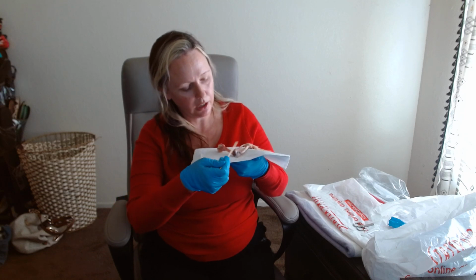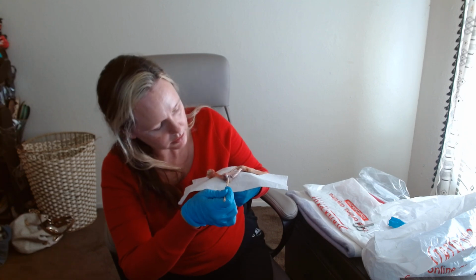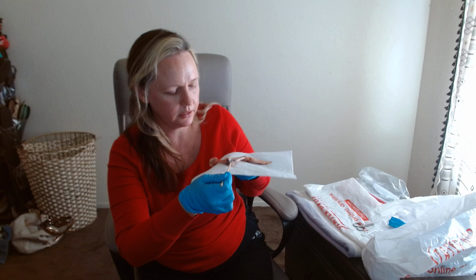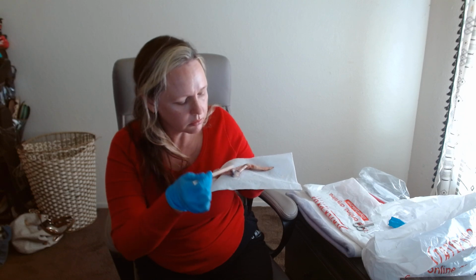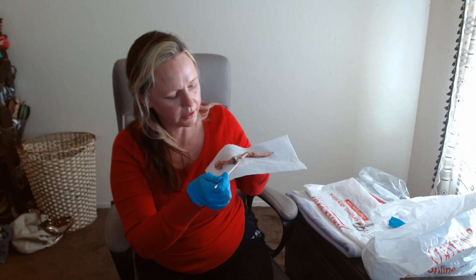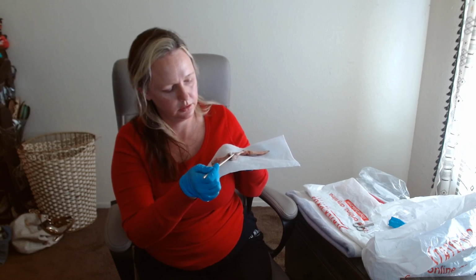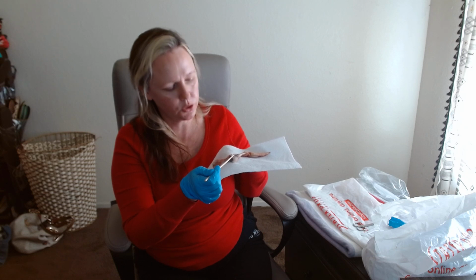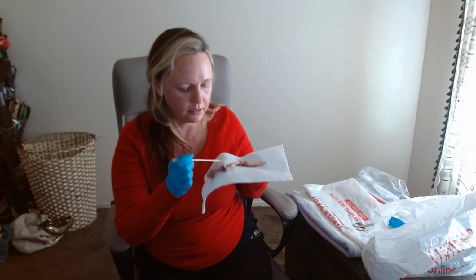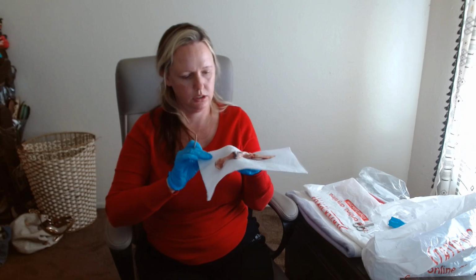Next we have the elbow joint as mentioned. Inside right here is the synovial fluid, and then we have the synovial membrane on the outside, that is the lining of the joint capsule. Right here is the tendon, and then this is the articular cartilage. So this is my chicken wing.